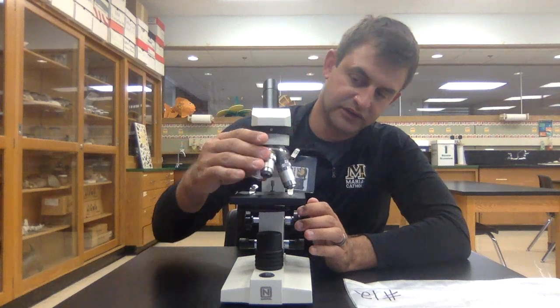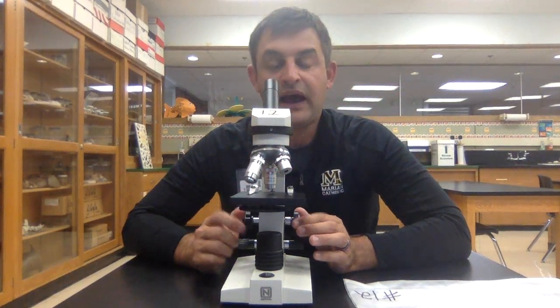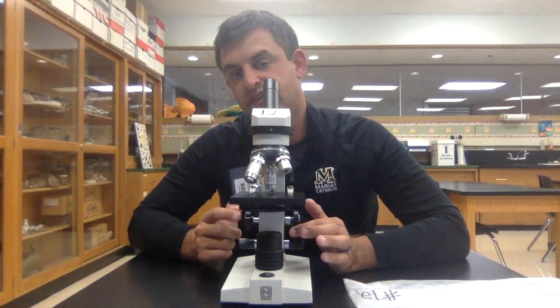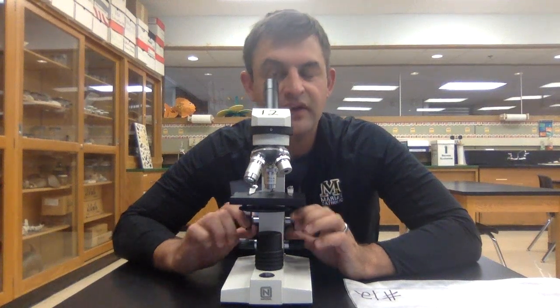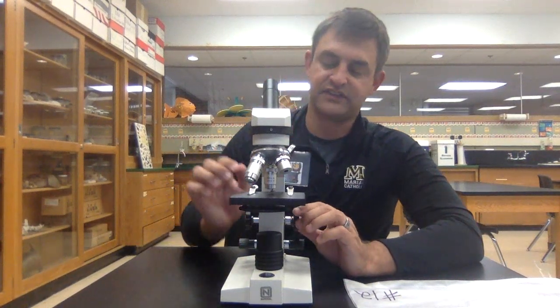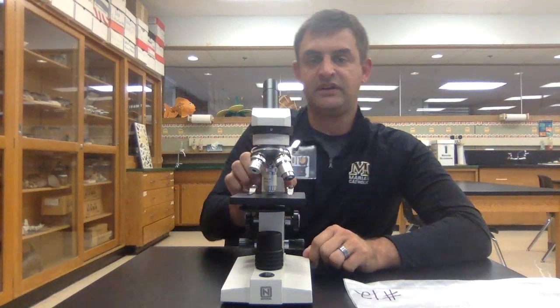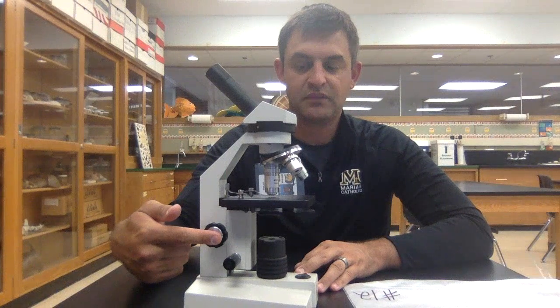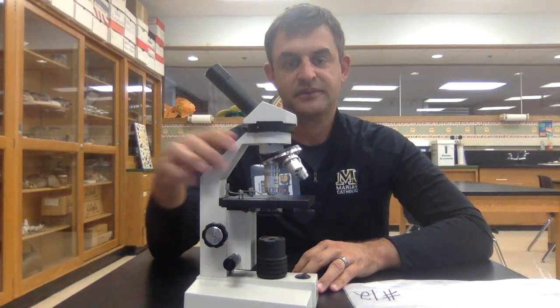Then you're ready to go to low power, which is yellow. On low power, you can still use the coarse adjustment knob — just check and make sure — focus on the specimen again, and then turn to high power. At that point, you are restricted from using the coarse adjustment knob, as it will break through the slide. So you're only using the fine adjustment.